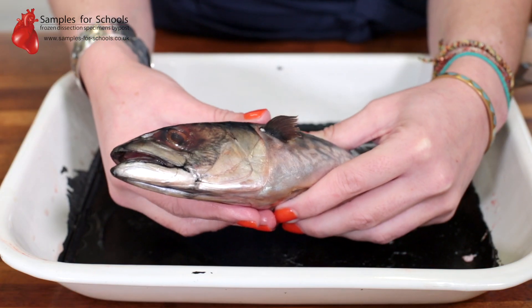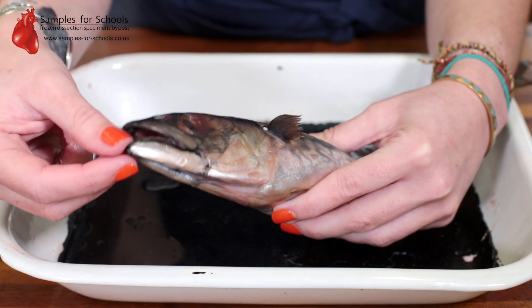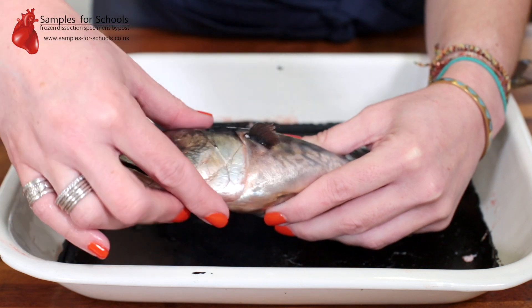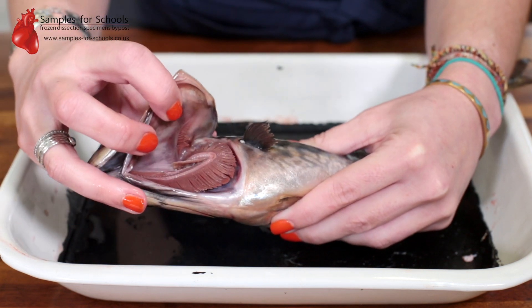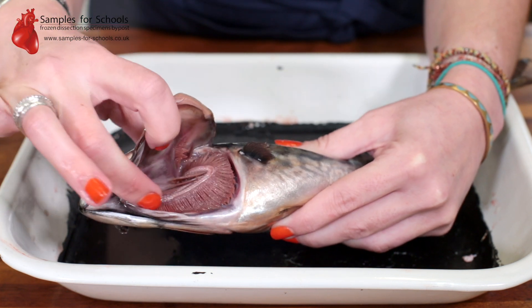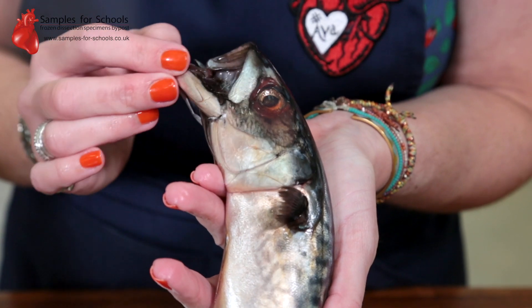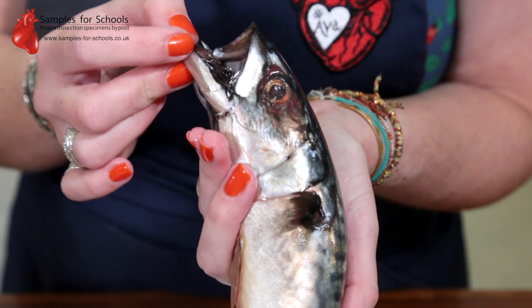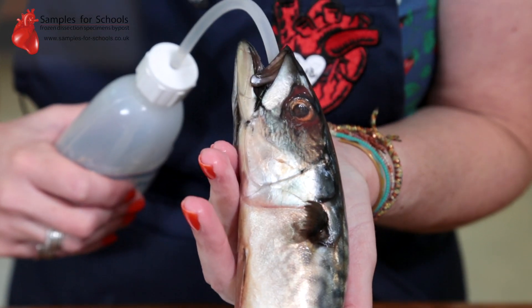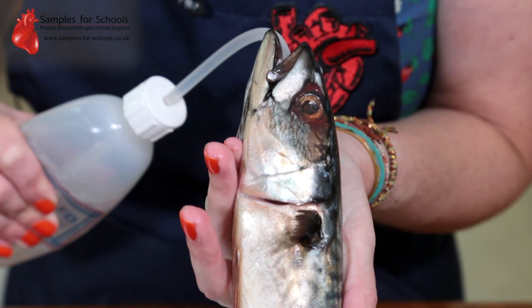In order for the fish to obtain oxygen from the water, it takes water in through its mouth and out through the operculum, the gill cover, forcing the water over the gill. We can show you the direction of the water movement by opening up the mouth structure and watching the flow out through the gill cover.